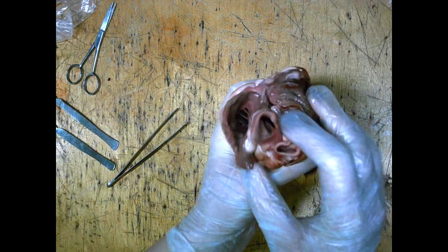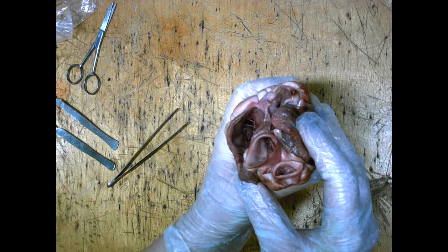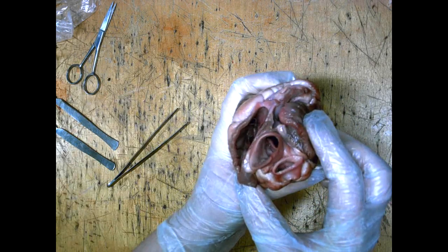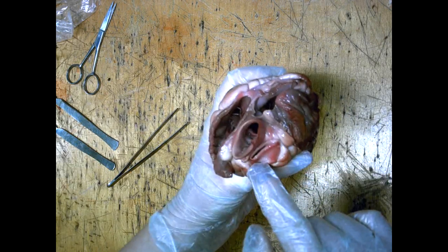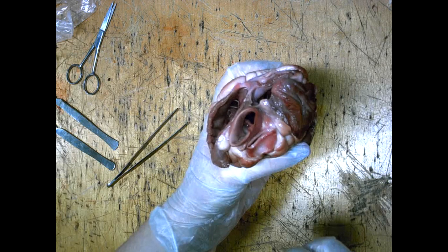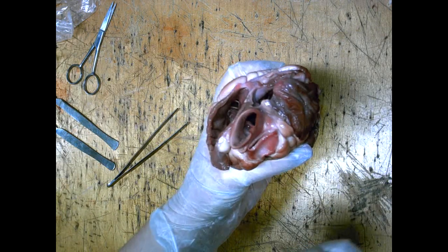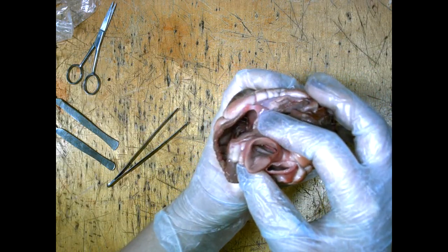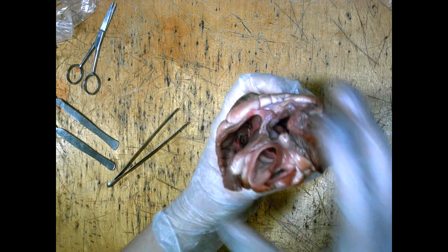You can also see the two arteries that leave the heart. The pulmonary artery carries blood from the heart to the lungs. The aorta carries blood from the heart to the rest of the body.